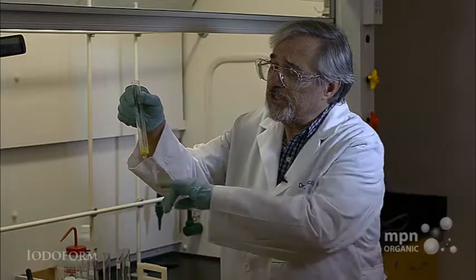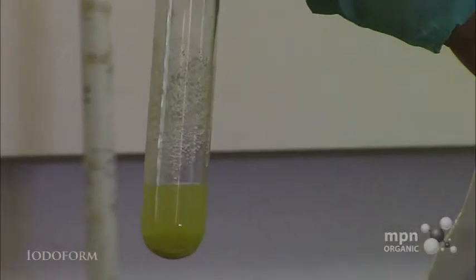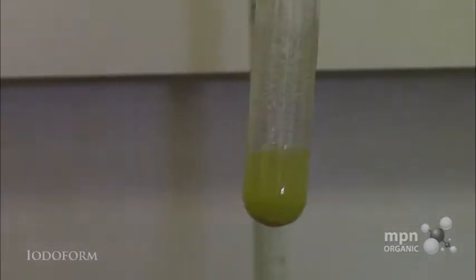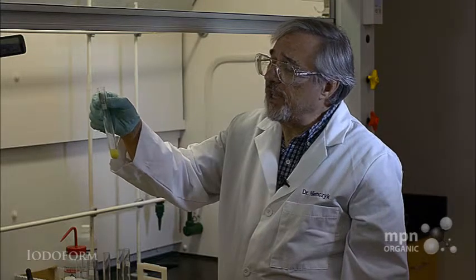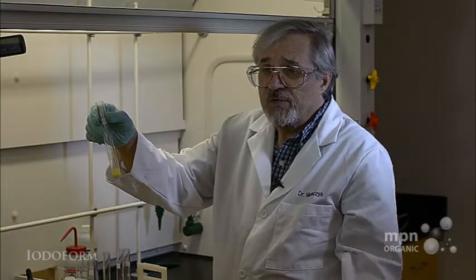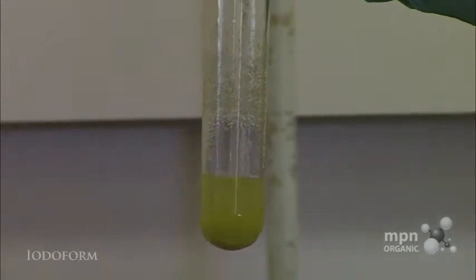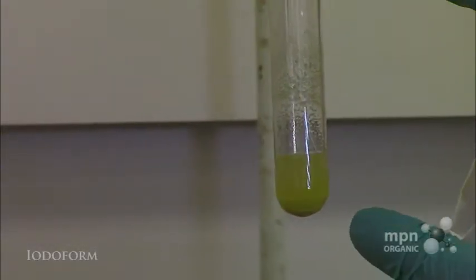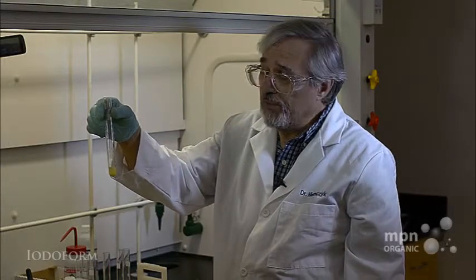This is CHI₃ — this is iodoform — and it forms if you have a methyl ketone: CH₃ and then a carbonyl. This can then be suction filtered, recrystallized, and if you want to verify that you did have a methyl ketone and that this is actually iodoform, you'll take a melting point of it. And that's how one performs the iodoform test.